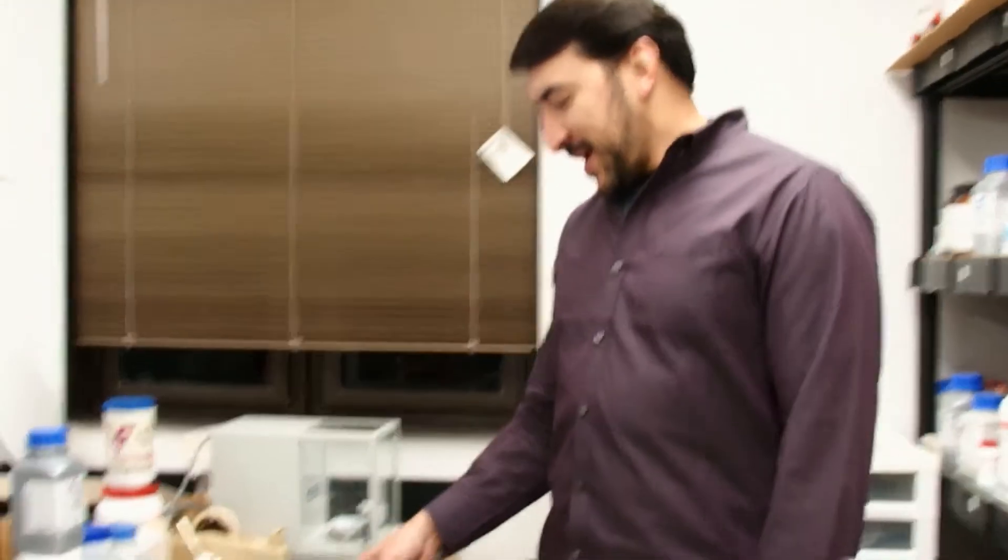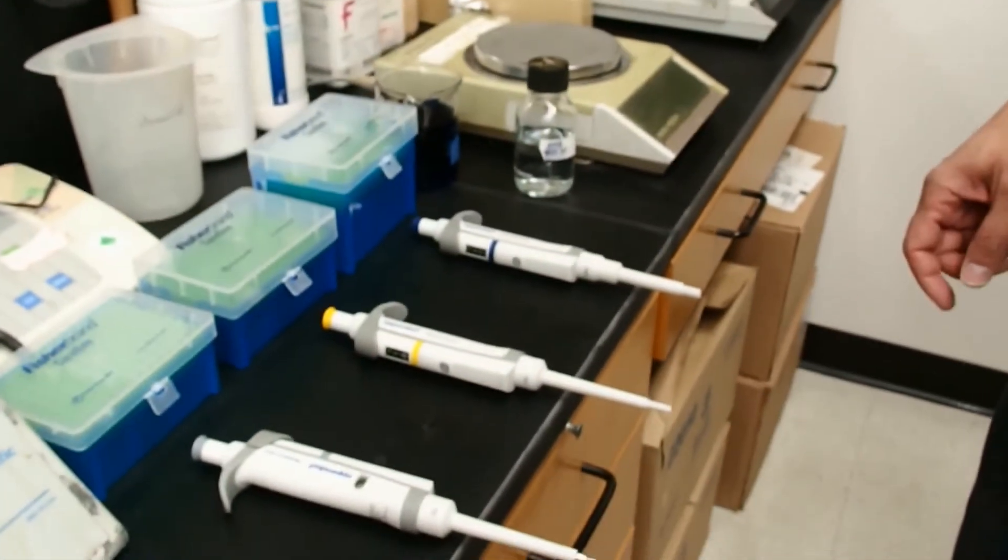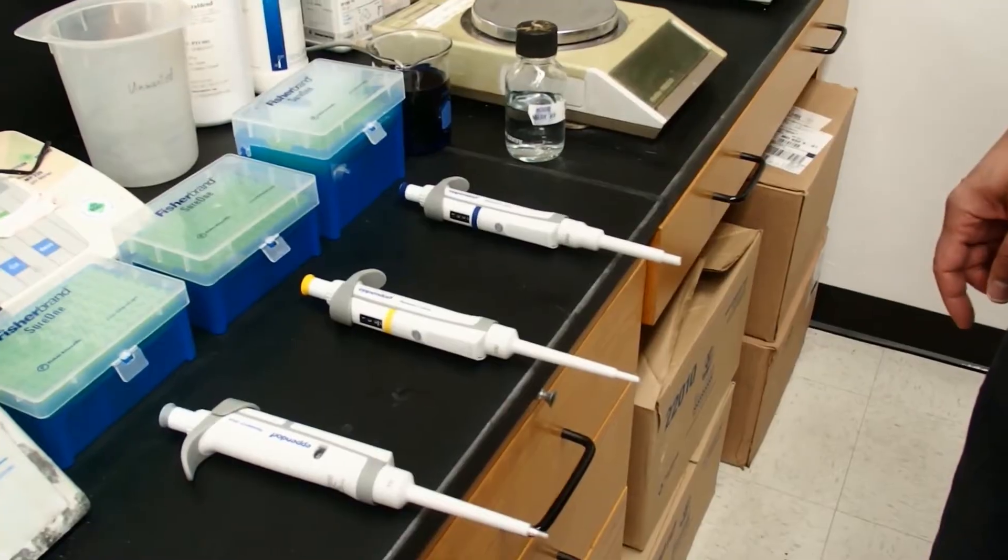I'm going to teach you how to use micropipettes.